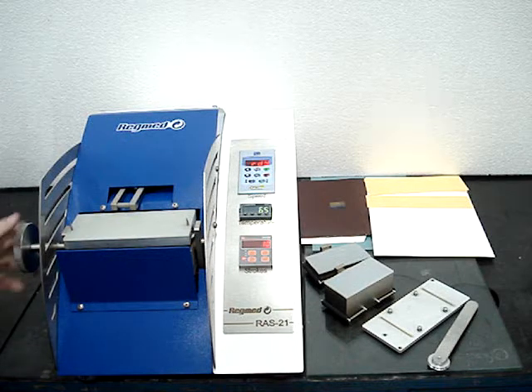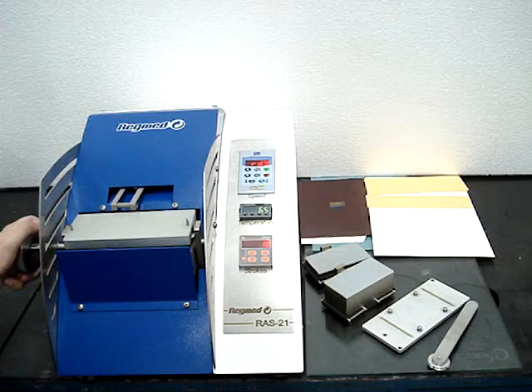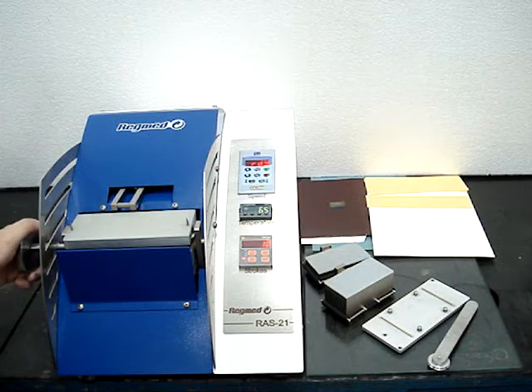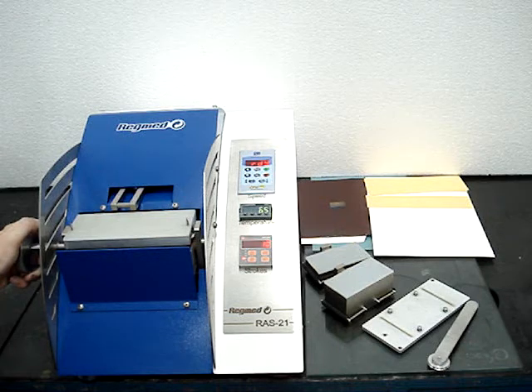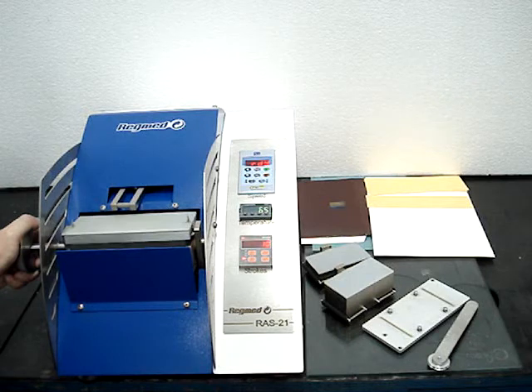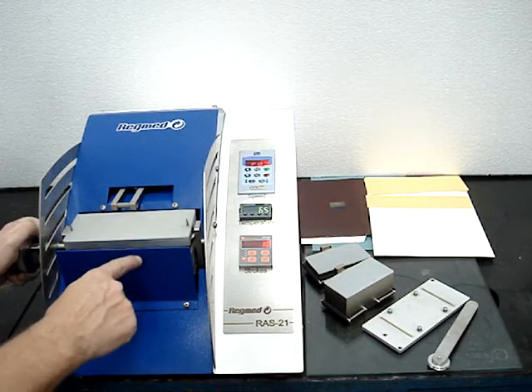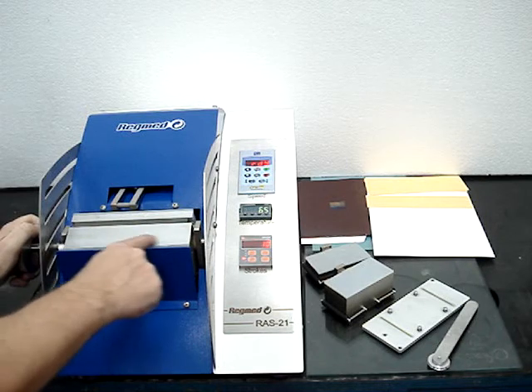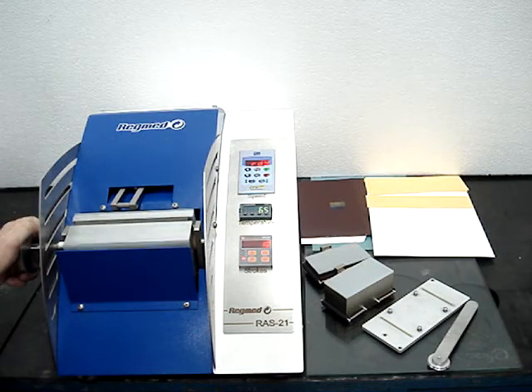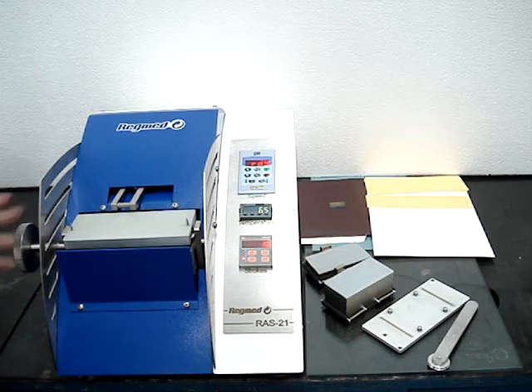First, choose if you want to use the heatball or the non-heatball test bed. You can choose by turning the knob at the left side of the equipment while the equipment is not running and without the test weight mounted on it. The heatball test bed is recognizable by the thin aluminum plate, while the non-heatball is recognizable by the thick aluminum plate. Turn it forward and back and you have access to both.